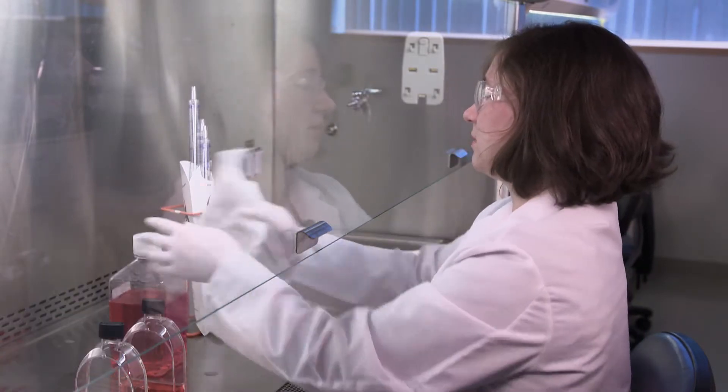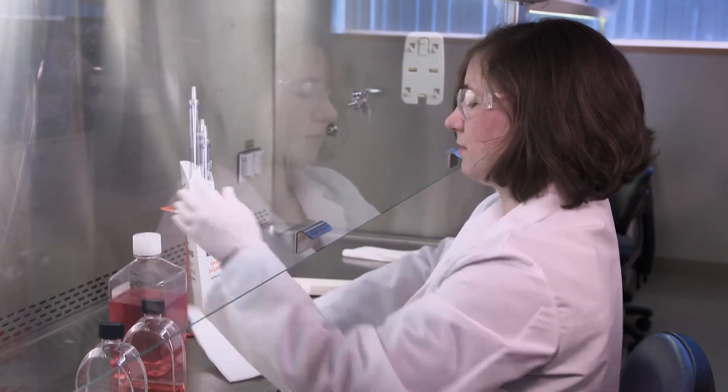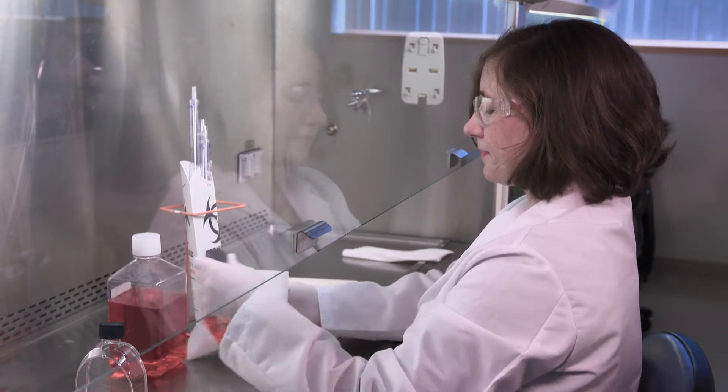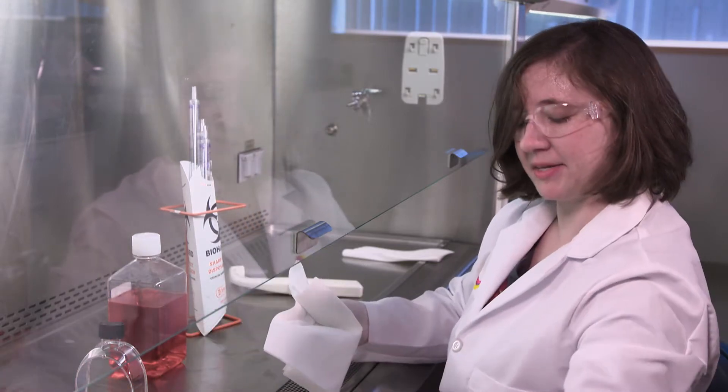Spills are wiped up, and you close your containers and then exit the biosafety cabinet.